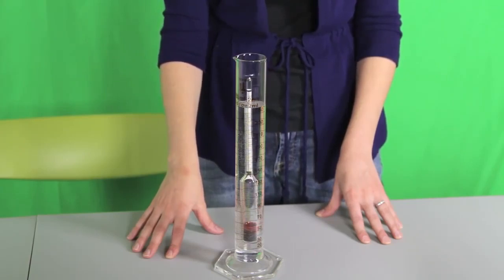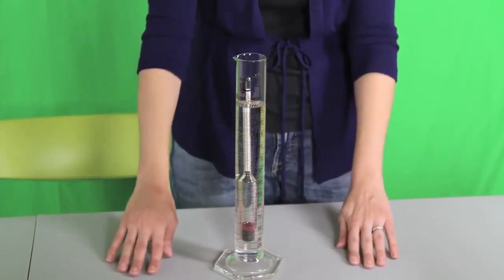Also, make sure the test cylinder is level so the hydrometer does not touch the sides.